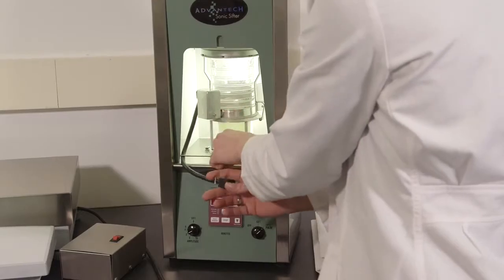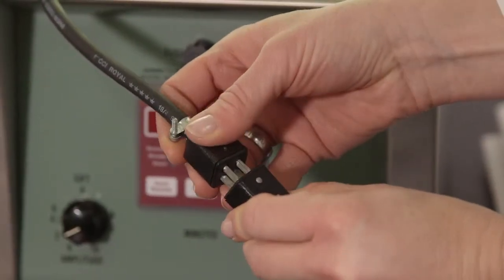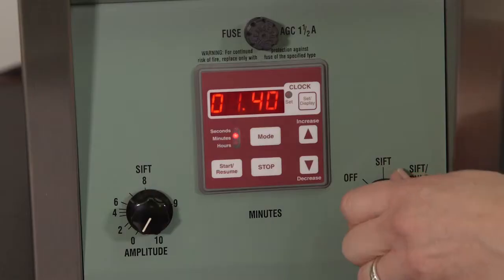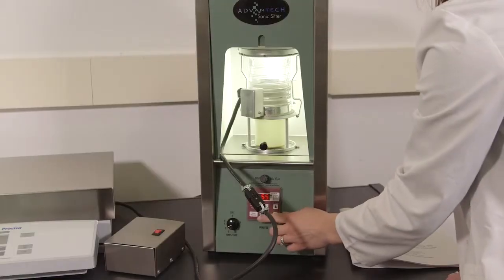Plug the line cord into the power supply. Use care in properly aligning the four pins on the cable assemblies. Start the L3P unit as you would under normal conditions.